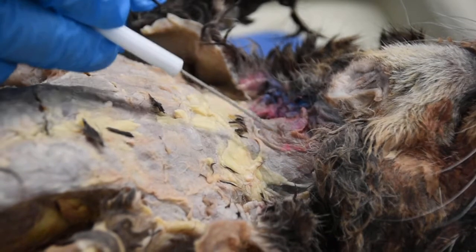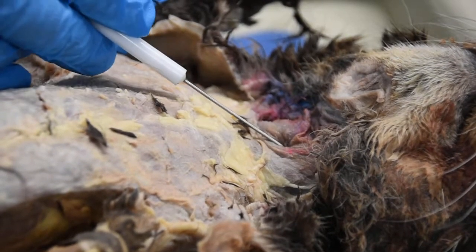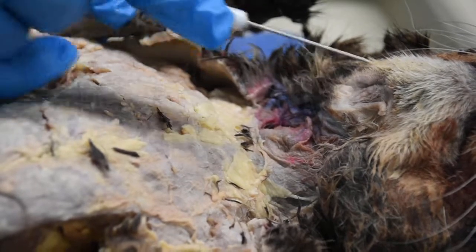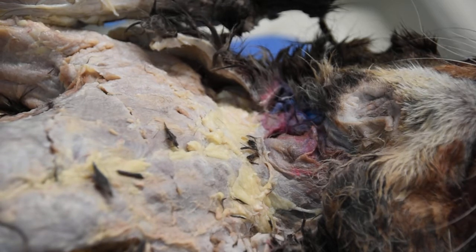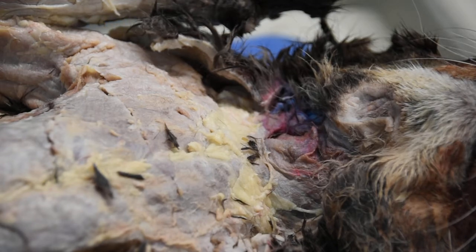Right at the center, you have these muscles called sternohyoid. And I didn't dissect this through, but if you look underneath the chin right about here, if I remove the skin right here, there would be another muscle underneath that, and that muscle would be your digastric muscles. So that is it in terms of the names of the muscles I do need you guys to know.